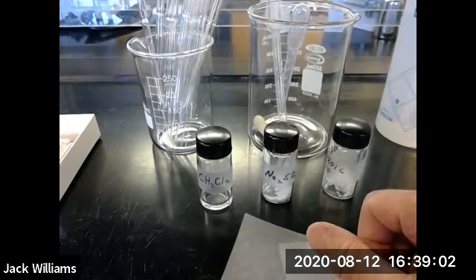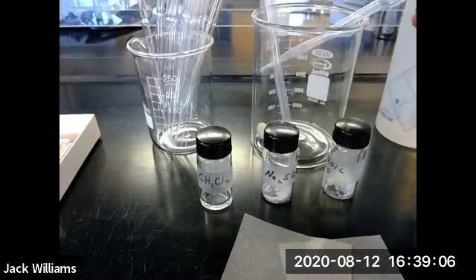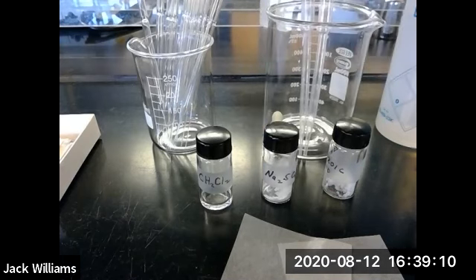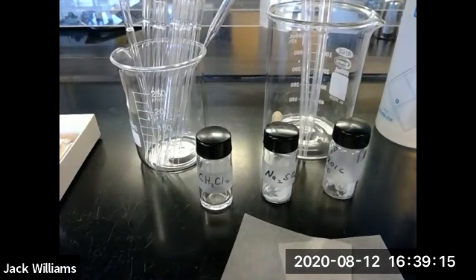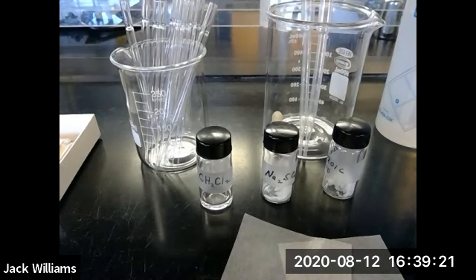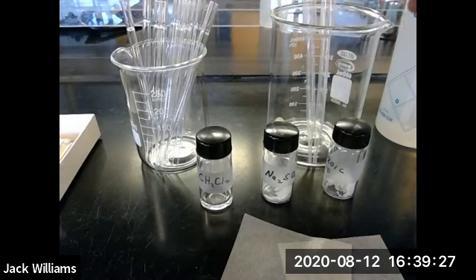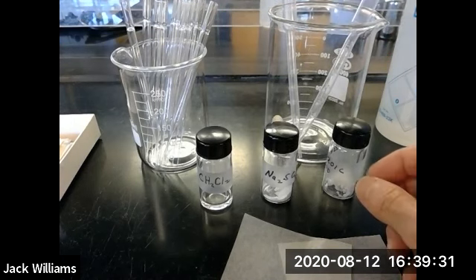And you're also going to use some pipettes. These are polyethylene, these are plastic disposable pipettes. And we also have some glass, we call these Pasteur pipettes. These are also disposable. When you finish using those, you can discard these into a waste beaker, which every hood has. It'll have a little red tag on it. And that's where you put glassware or droppers like this after you use them.